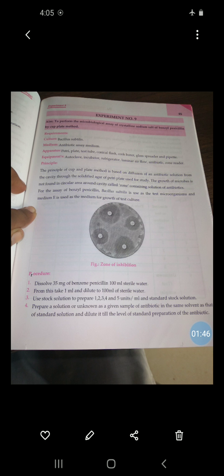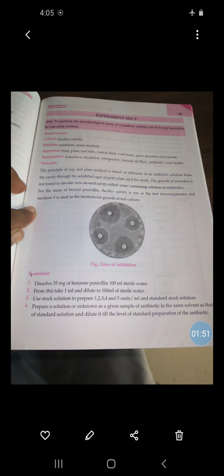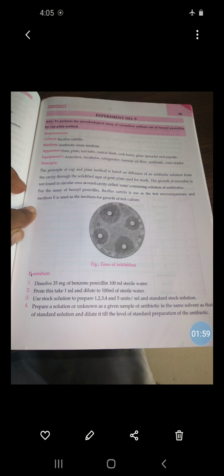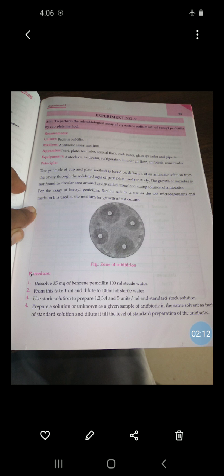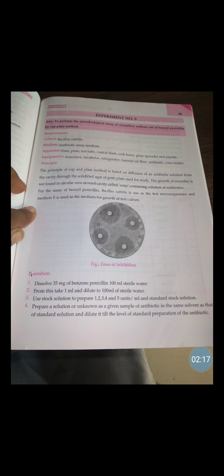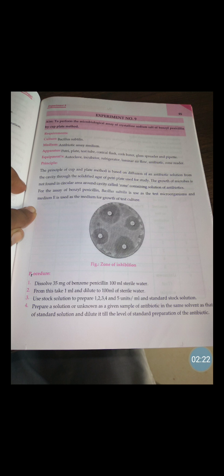The principle of the cup and plate method is based on the diffusion of an antibiotic solution from the cavity through the solidified agar of the petri plate used for study. The growth of microbes is not found in the circular area around the cavity, called the zone of inhibition, containing the solution of antibiotics.